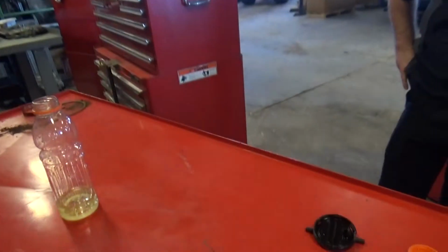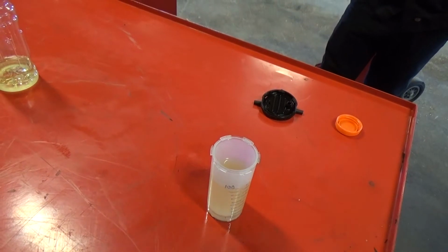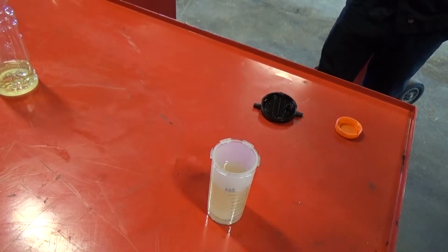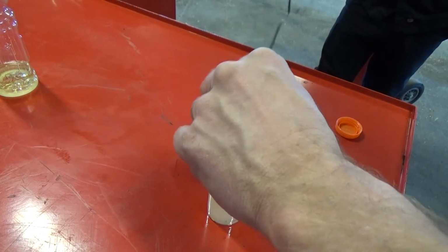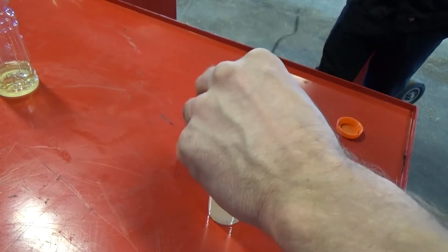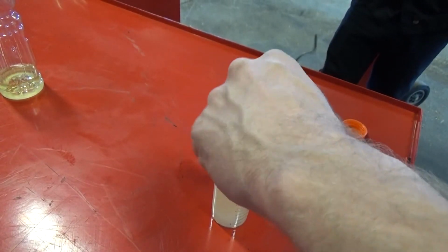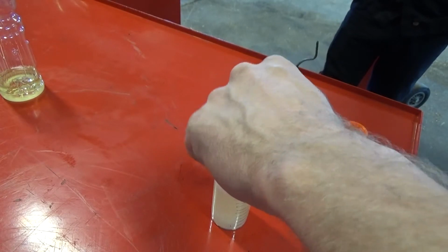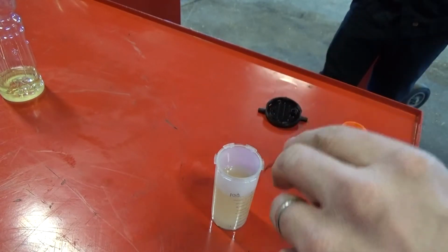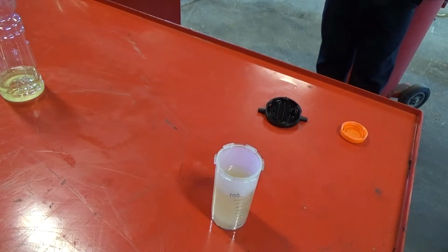And yeah, we'll go ahead and make these people sick watching this video. Let me take that wire and kind of just, because when you do this test, your textbook describes it. It says vigorously shake. If you're James Bond, you don't like it shaken, you like it stirred, right? There's my little joke. You guys love my humor. All right. So stir that up real good, and we'll let that settle. They say let it settle for a minute. So thank you. There's your wire back.